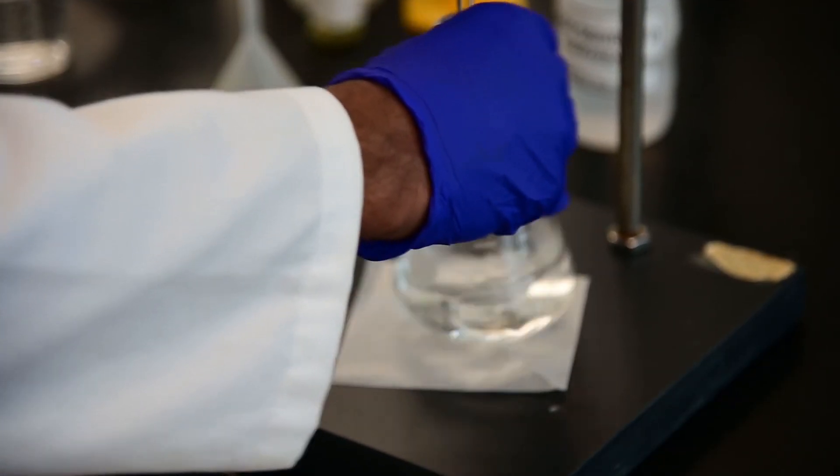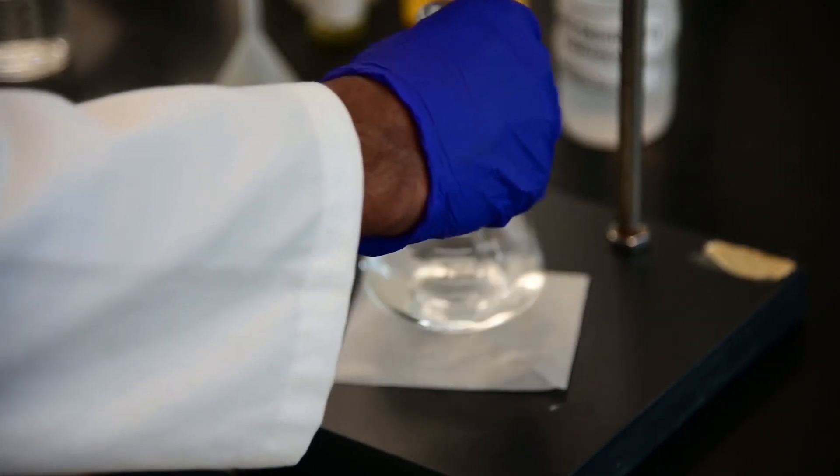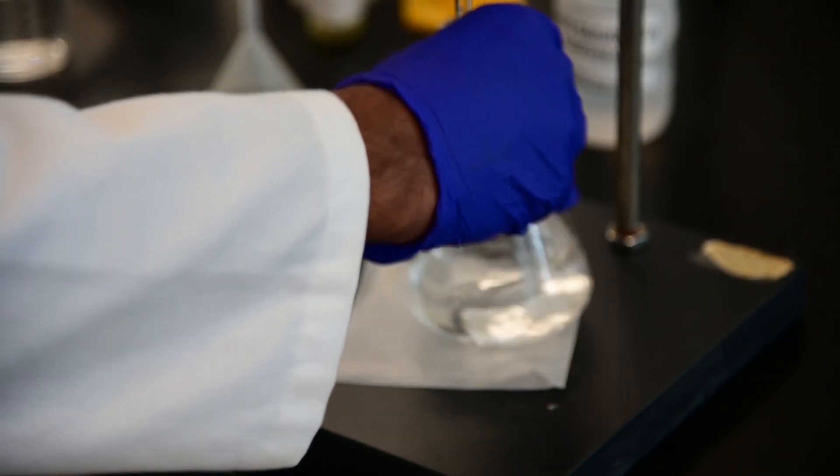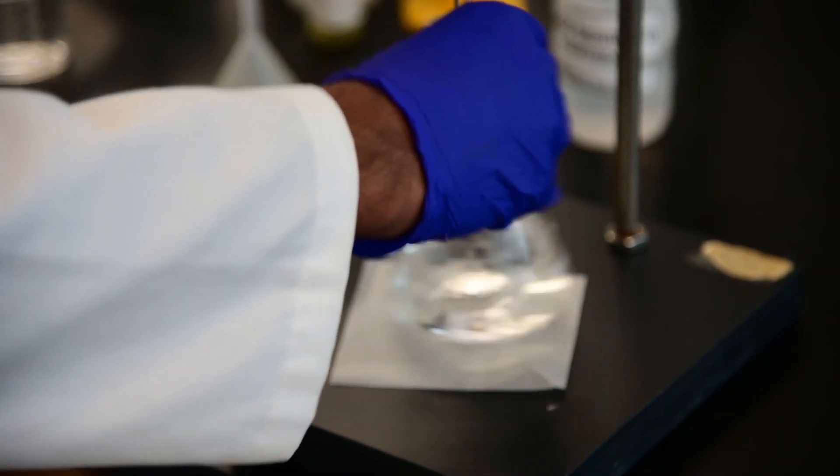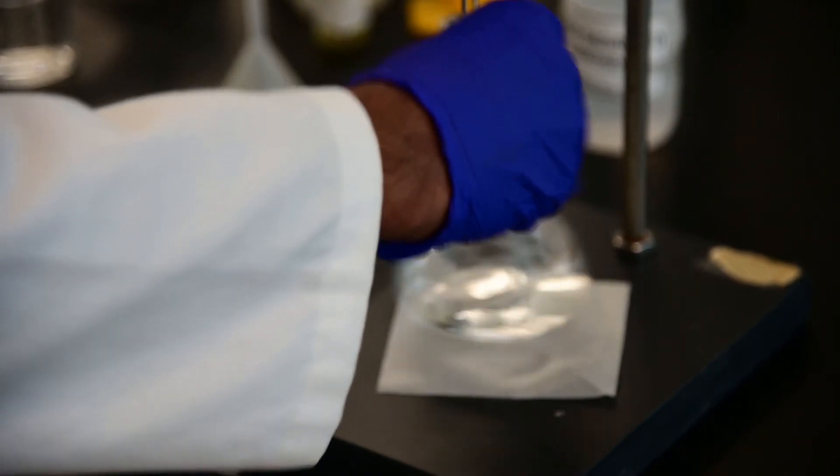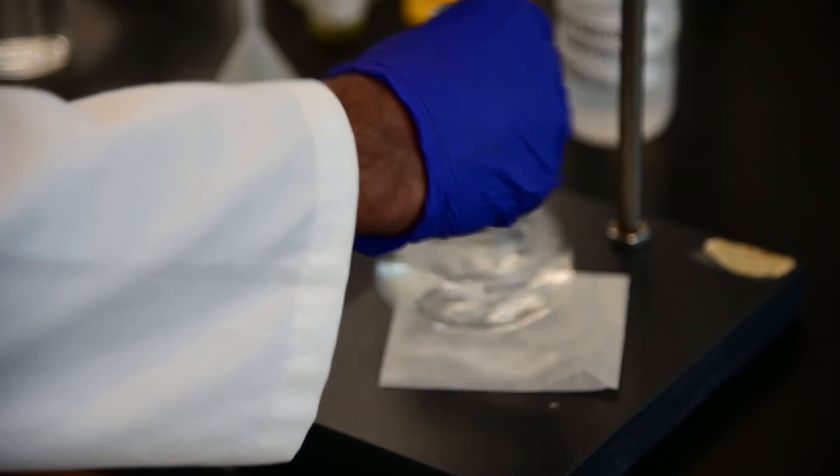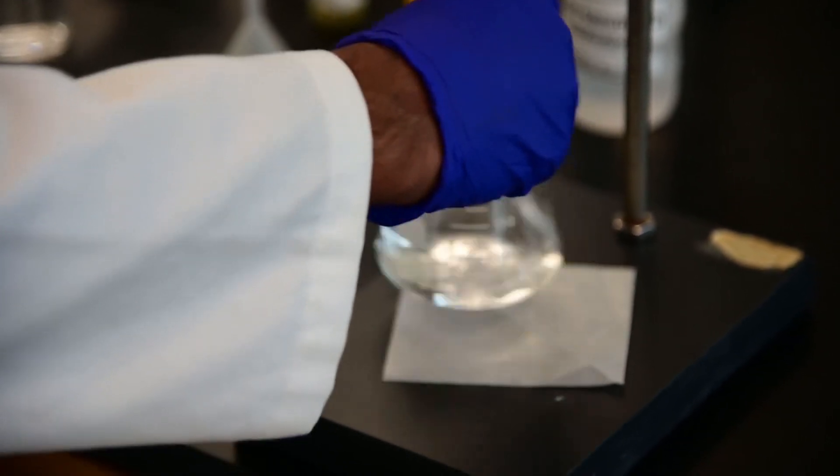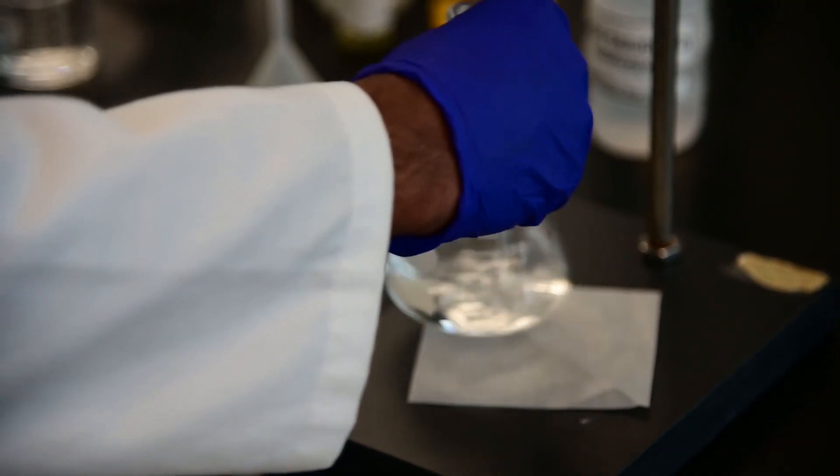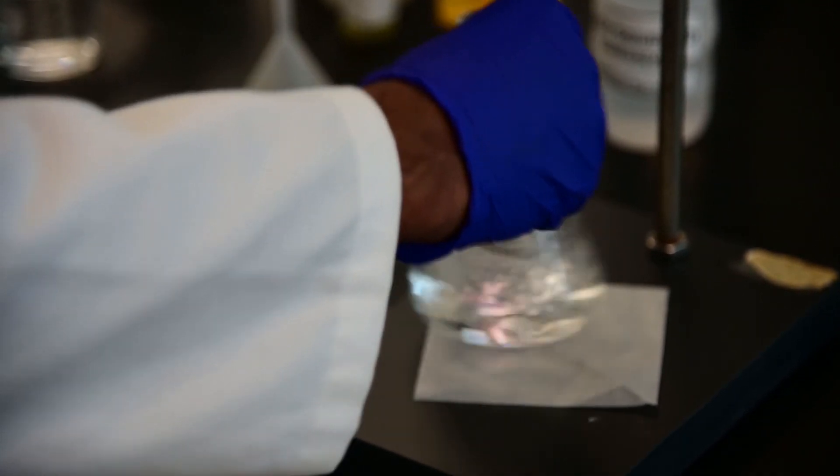So we keep adding. I like doing my titration at a slow and steady rate of addition. I don't change that.